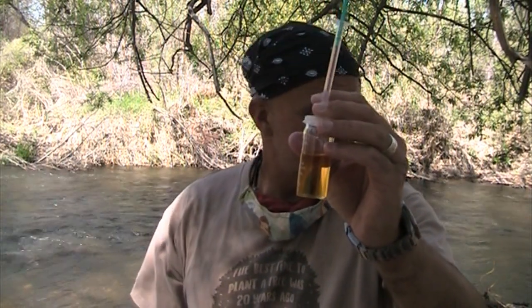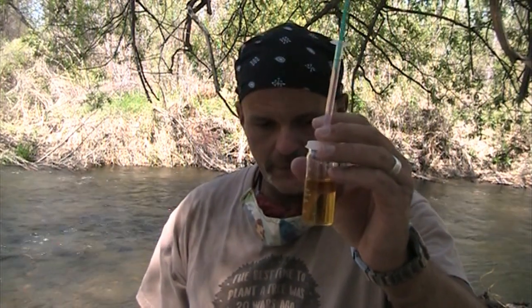You're now going to put the creepy nurse syringe of science into the titrator tube. And my goal is to get this a very pale yellow. A good example of pale yellow is a yellow sticky note. For those of you adults, a nice Pinot Grigio is the color you're going for. And I always tell my students you want to put in a few drops and do the swirl of science. The bad scientist in all of us wants to empty the entire syringe.